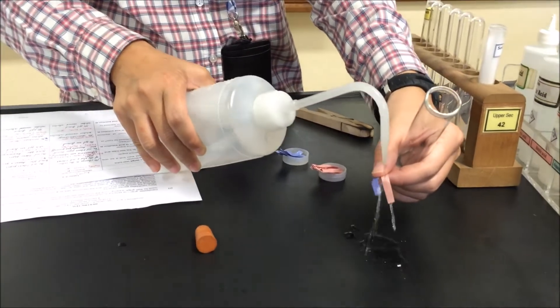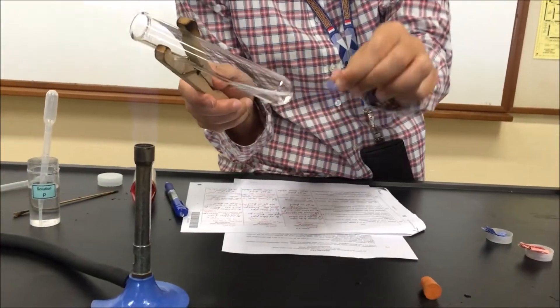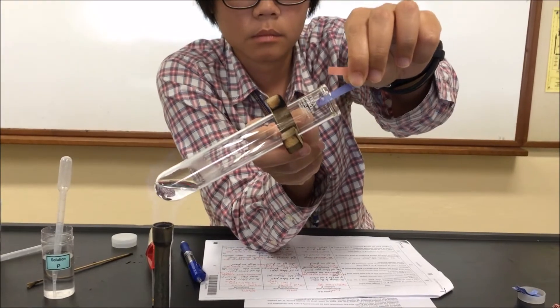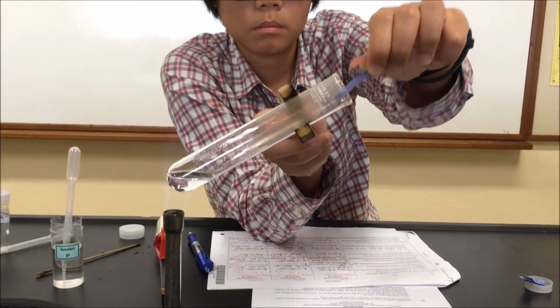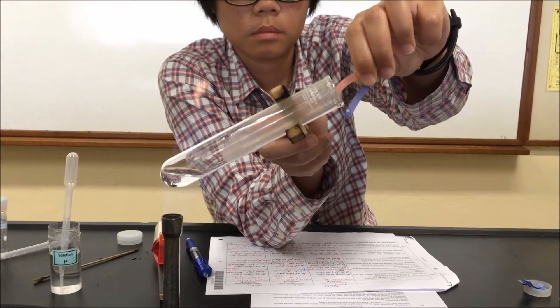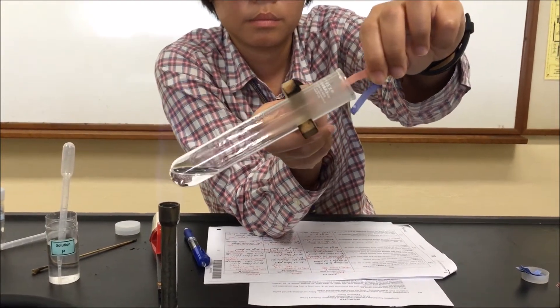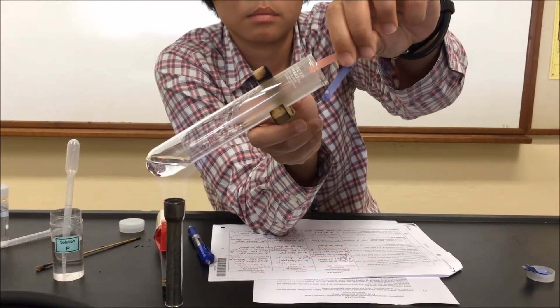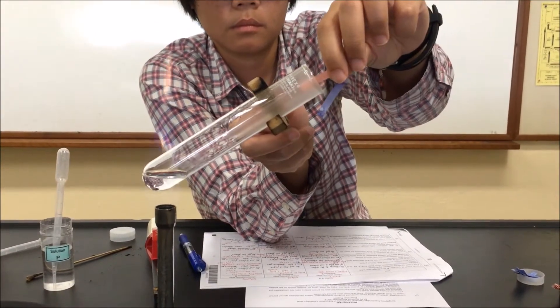You notice that when I place the blue and red litmus at the mouth of the boiling tube, the papers do not touch the boiling tube at all. This is to ensure that any change to the blue or red litmus is entirely due to the gas and not due to any solution at the sides of the boiling tube. We have added sodium hydroxide and we are warming it — this is the test for the ammonium ion; we are finding out if ammonia gas is given off. The result is negative: blue litmus remains blue and red litmus remains red.